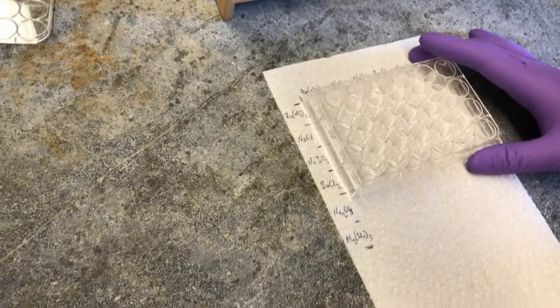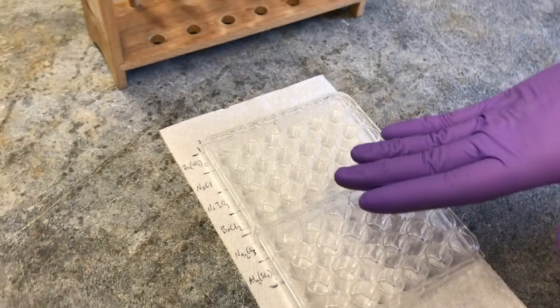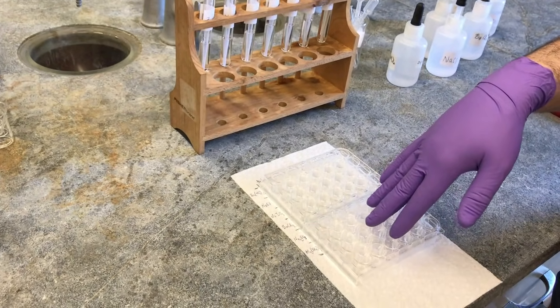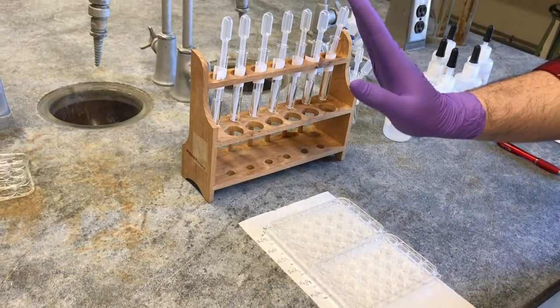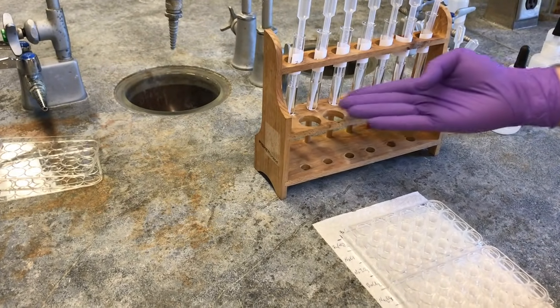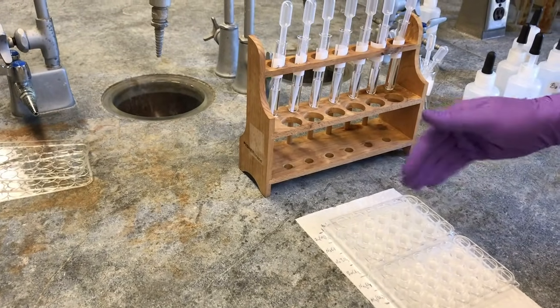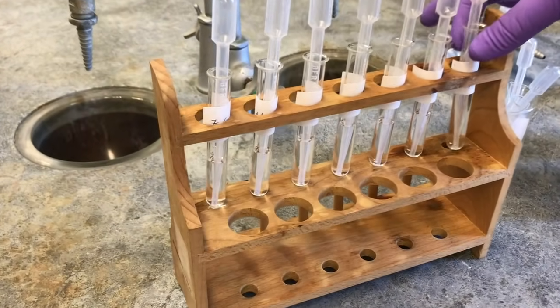So let's get started. In the interest of time, we're going to be using a second well plate. Students usually will be using one, but like I said, for the interest of time, and since we're social distancing, no one else is around, so we can use all the equipment we want. So what you'll do is we have this test tube rack set up with our knowns, and I have lined them up in order in which they'll appear on this piece of paper towel in the order that we're going to fill this in. And then we also have, of course, the acetic acid.